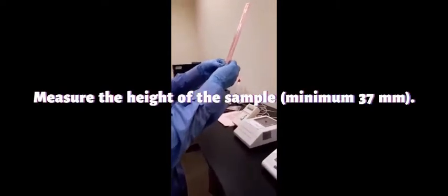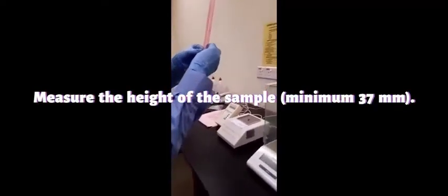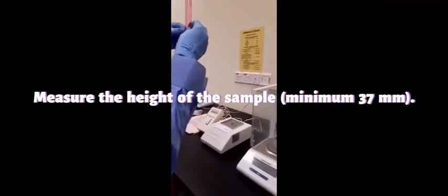The sample is now completely packed, and the height is around 37 millimeter.